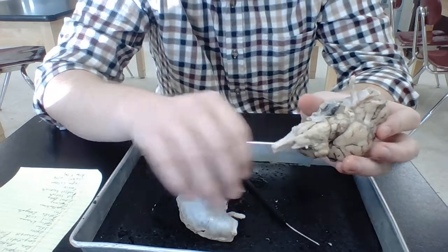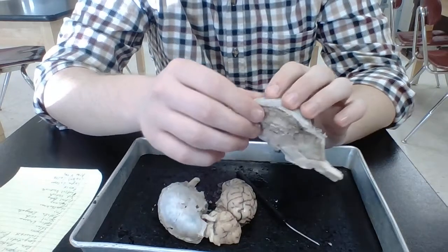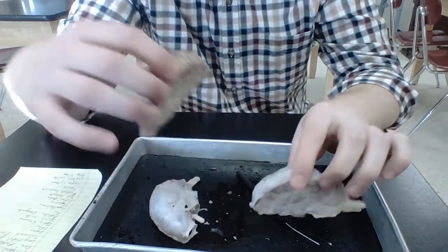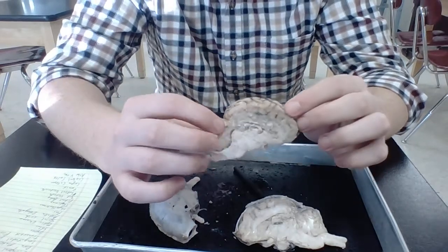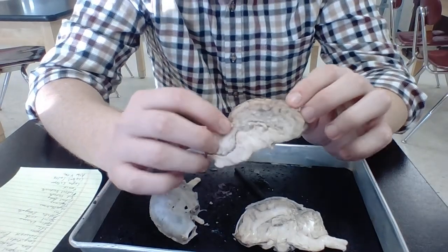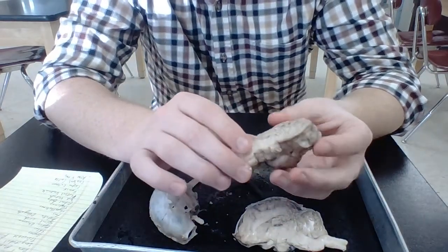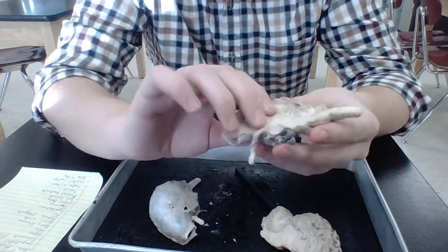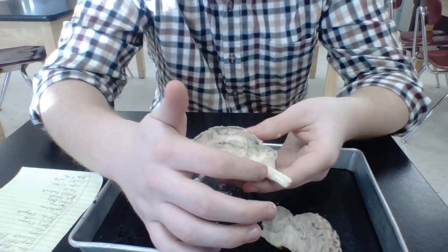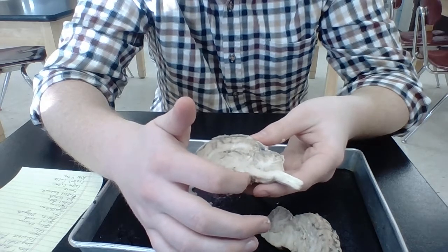All right. So we're going to take a look at the inside. So the rest we have to split it open. What we did is we took a scalpel and split this in two. So if you can see, as we already said, I'm going to use this half. We have the spinal cord, the medulla oblongata, and you get the pons kind of in here.